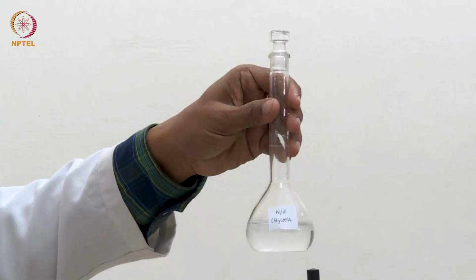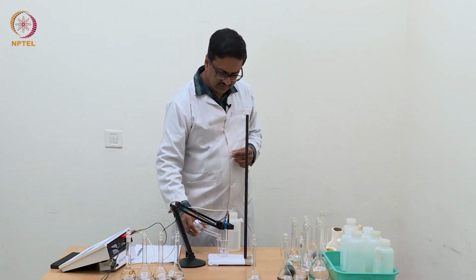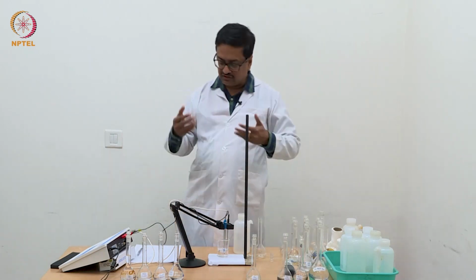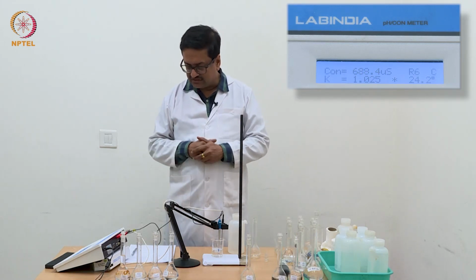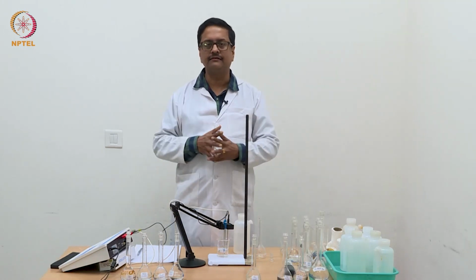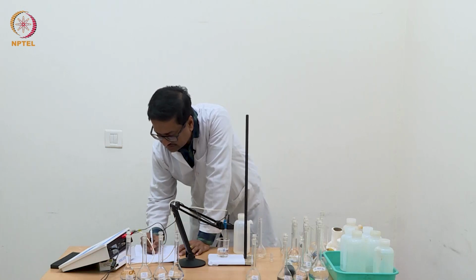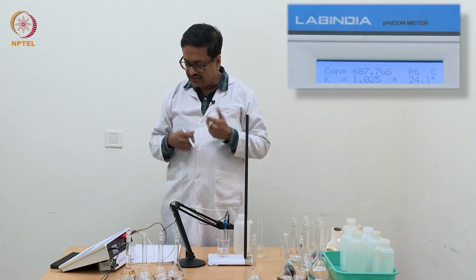This is the sixth solution, with N/8 concentration of acetic acid. So I am going to use this now. What we are seeing is that with increase in concentration there is an increase in conductance, but it is not doubling, or it is not a regular change, which indicates that it is not a linear change. For HCl, every time you doubled the concentration, the conductance was becoming double, which indicated a kind of linearity. Whereas in the case of acetic acid, when I make the concentration double, the conductance is not becoming double. So it is not showing a linear behavior. When we calculate the lambda C values, that is the equivalent conductance values, we will see a nonlinear behavior.